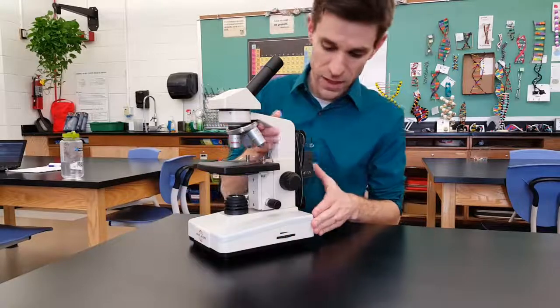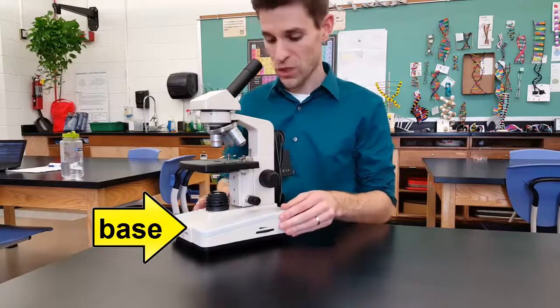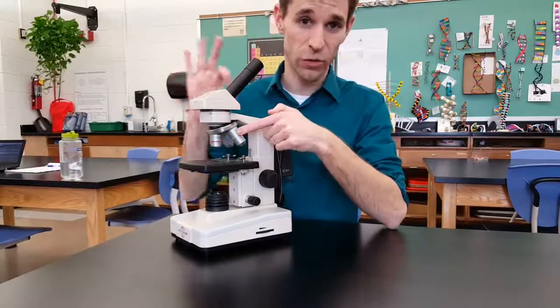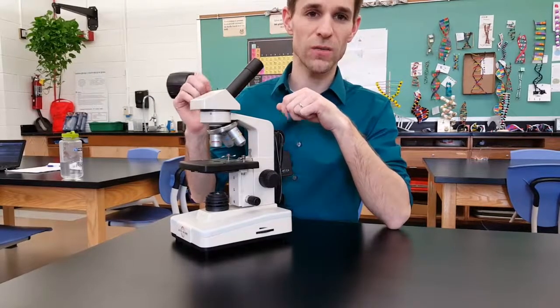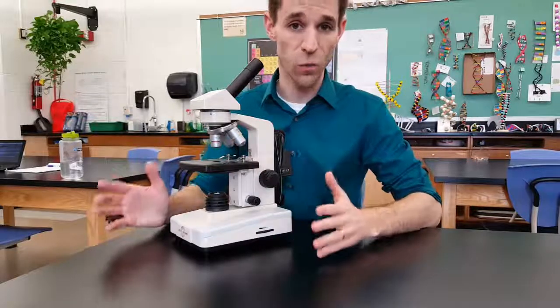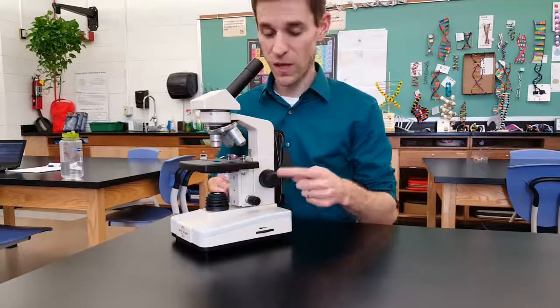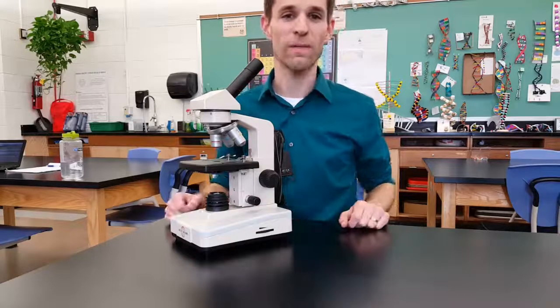So I think we've hit everything. We have the base, where all the electronics and the rechargeable battery are. We've got the arm, the head, the eyepiece, and the turret with the three objective lenses. One gives a collective magnification of 40x, the next 100x, and our highest magnification is 400x. This is the stage with the stage clips. There's the iris, the light adjustment, the rough focus knob, the fine focus knob, and the power button on the back.